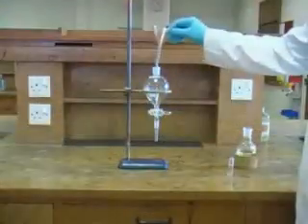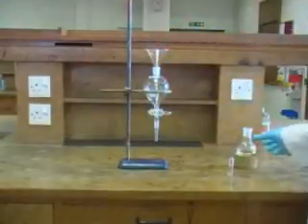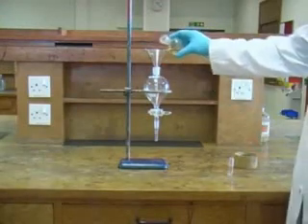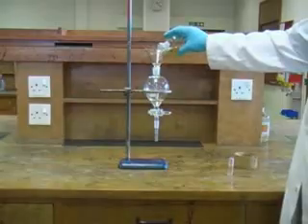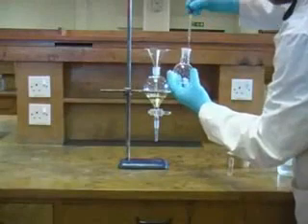We now need to pour the solution of our product into the separating funnel, taking care to avoid any spillages. So it's wise to use a small glass funnel as we pour. Then we can rinse our reaction flask with more ether to ensure that no product is lost.